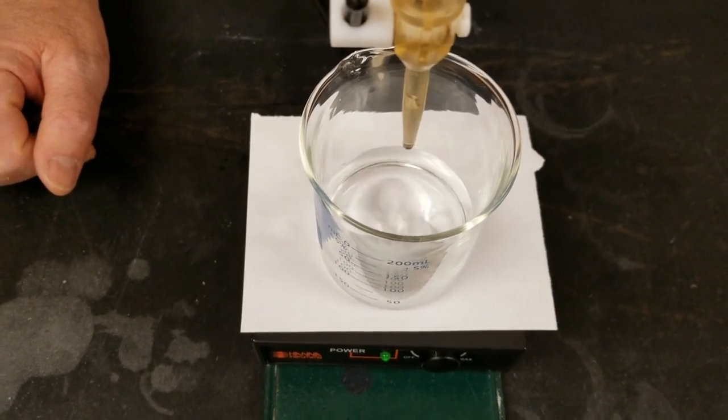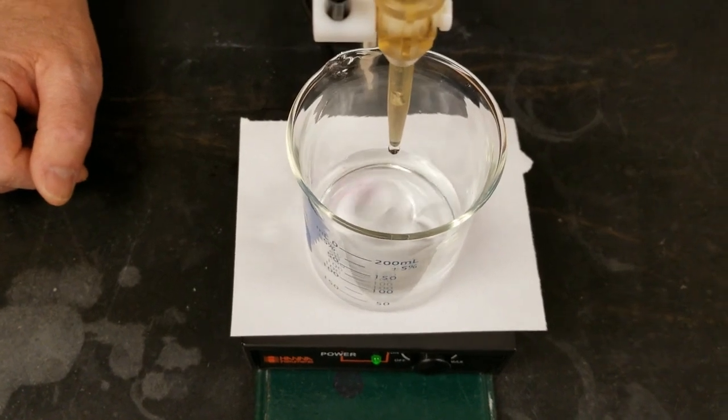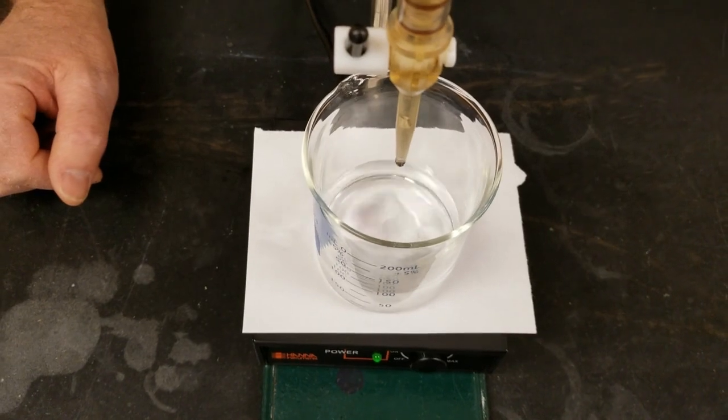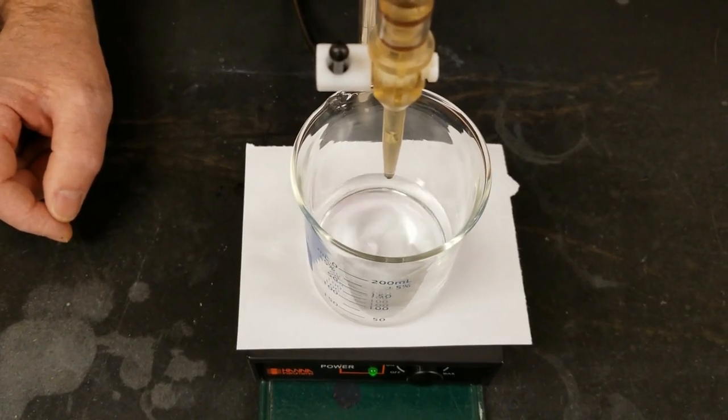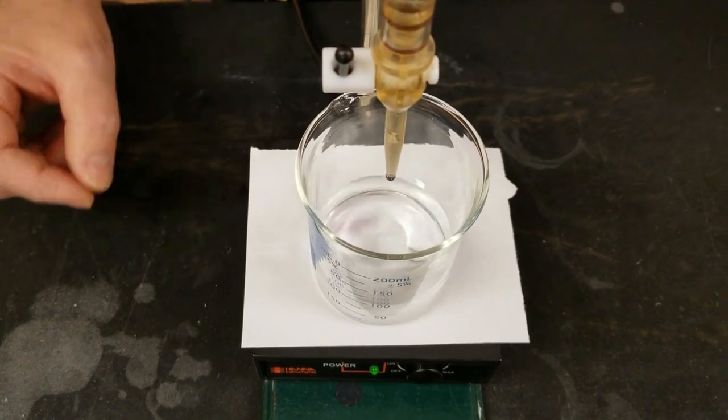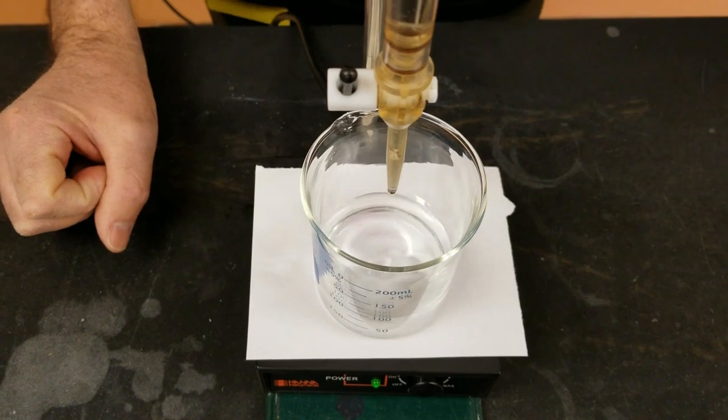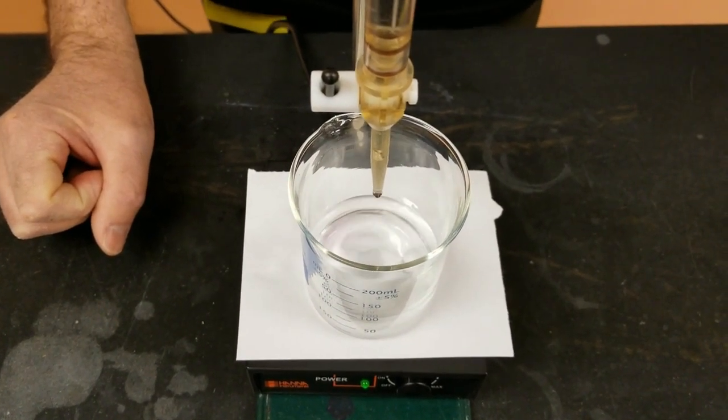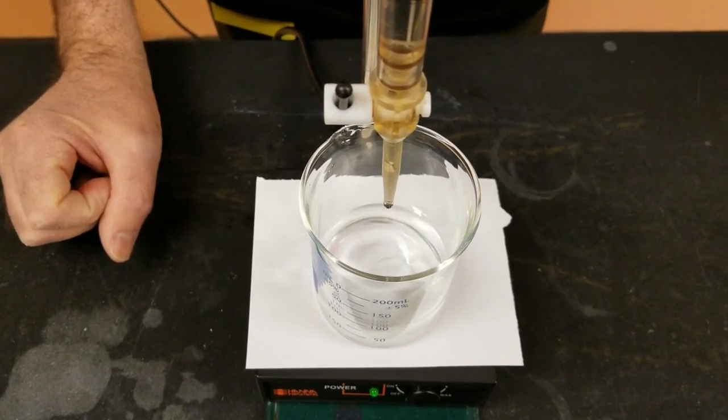You can see those little flashes of pink occurring and they quickly dissipate as they get neutralized or as the OH- neutralizes an H+ from the KHP remains colorless at this point. So nice steady drip. I've already let in about 6 mils of the base at this point. As we approach the equivalence point, what we're going to see is that the flashes occur, they become brighter and they last longer, they take longer to dissipate and go away.